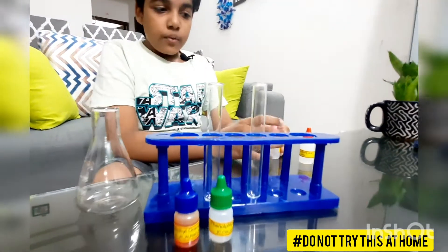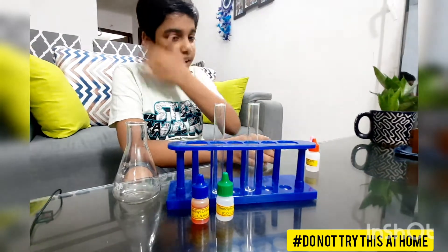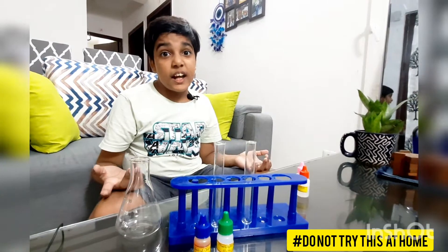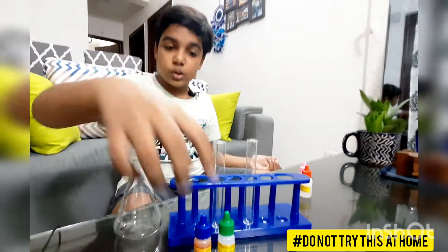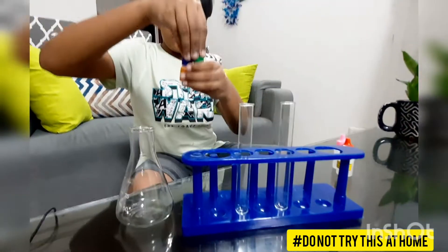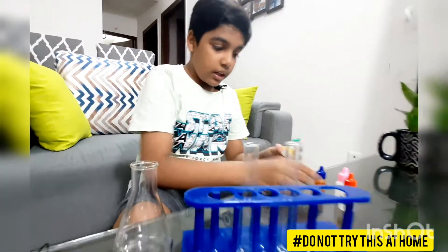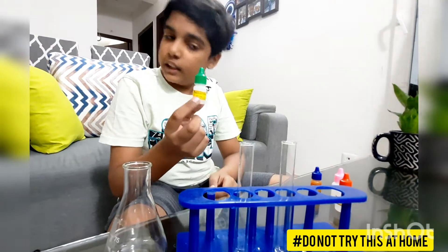I have put equal quantities of hydrochloric acid and sodium hydroxide. Now I am confused about which one is an acid and which one is a base. For this I have two indicators here: one is methyl orange indicator and the other one is phenolphthalein indicator.